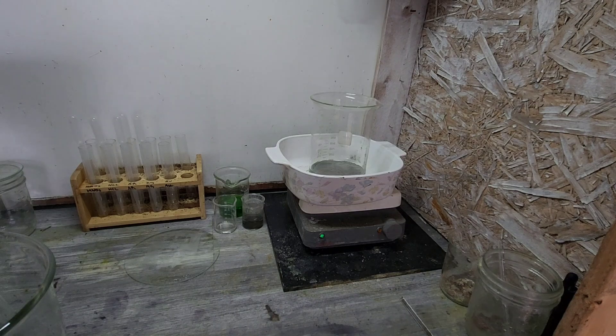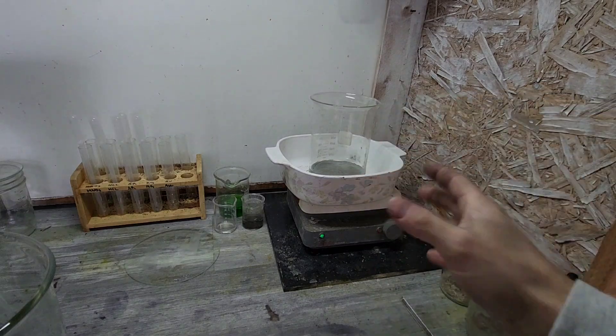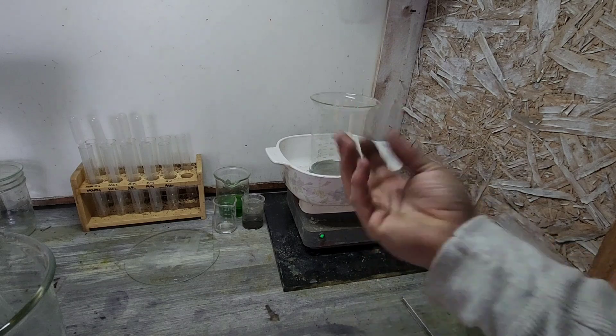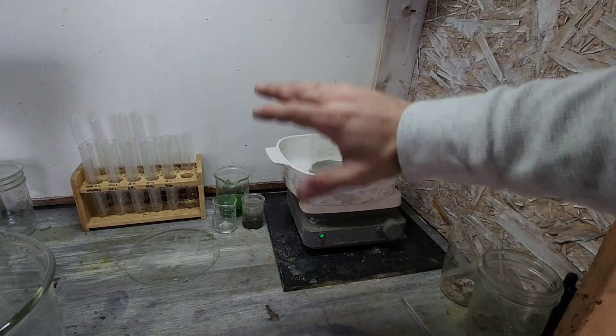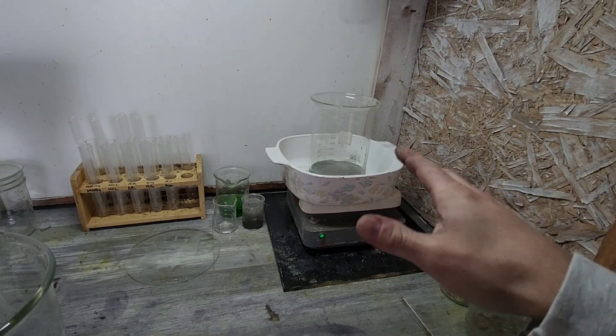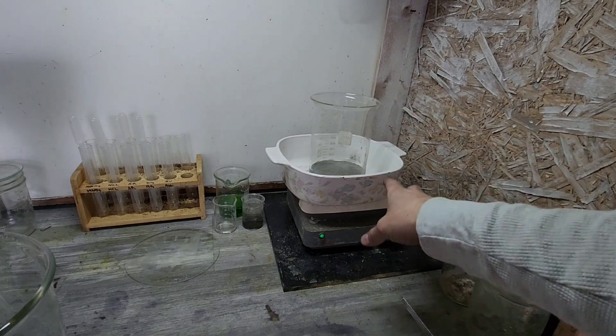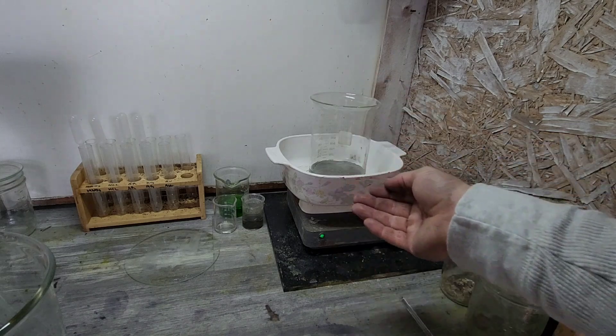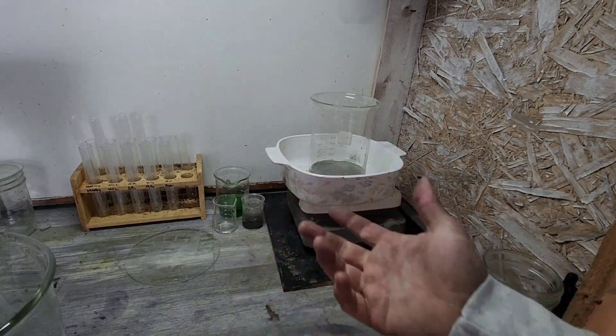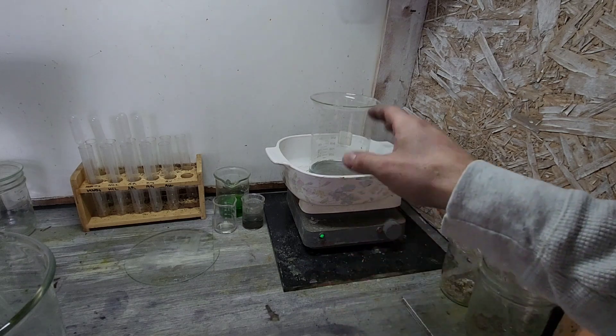Because it's impossible to get everything out, right? All of the water. Well, we're kind of drying it off like that. The purpose of evaporating it, so we can get every speck of water or solution out of there, right? But what happens is if you have this too hot, is one, you cook the whole bottom and it makes it a really big pain in the rear to get it off. But two, you can actually get little steam explosions in there, and then your silver is up and everywhere.